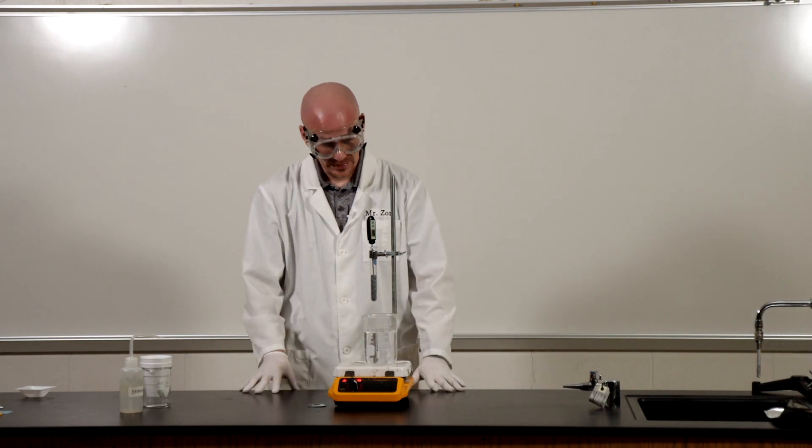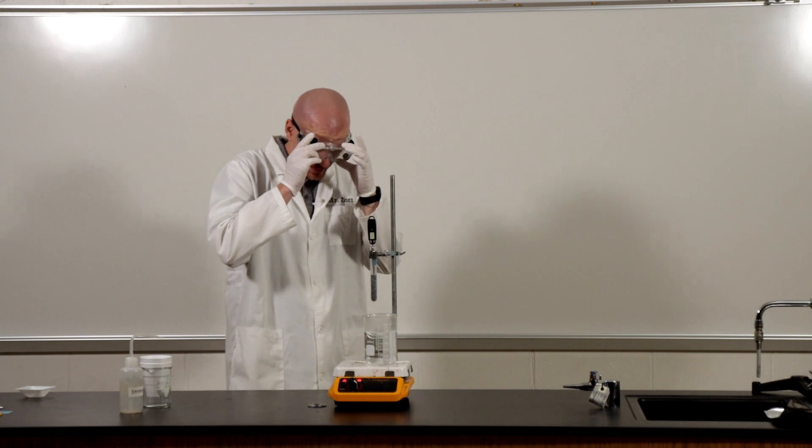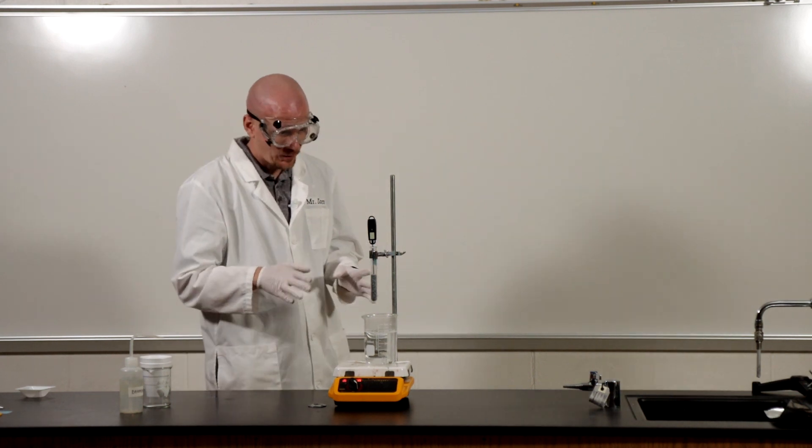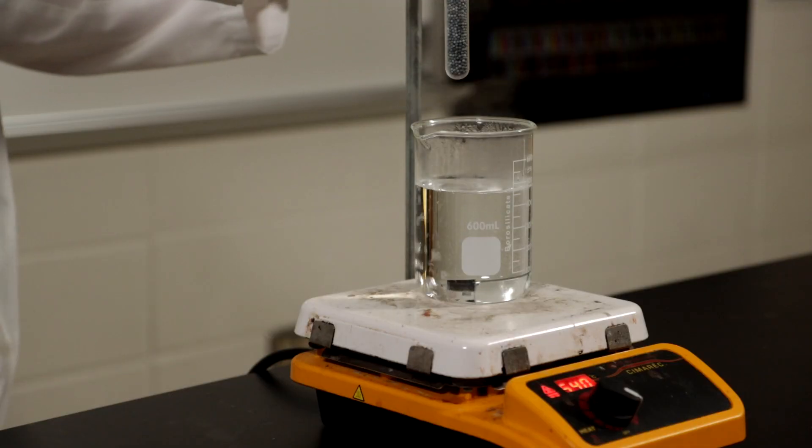Okay, so I've got my hot plate set up here and what I'm going to do is I'm going to lower my test tube into the boiling water. I want to make sure that all of the metal is below the water line here so I'm going to be very careful.